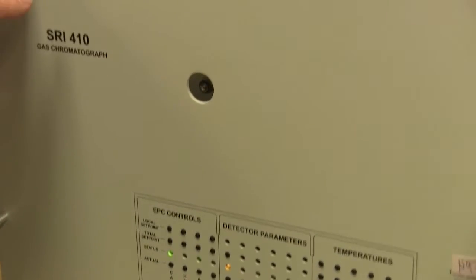So thank you. Hopefully that'll help you make sure you can determine if your FID detector is lit.